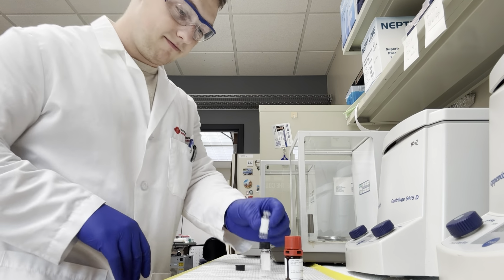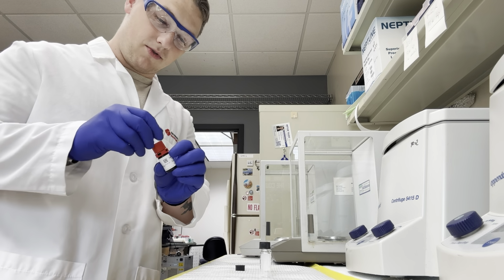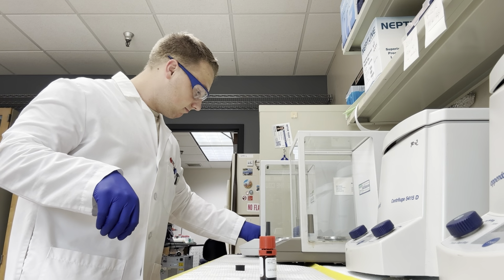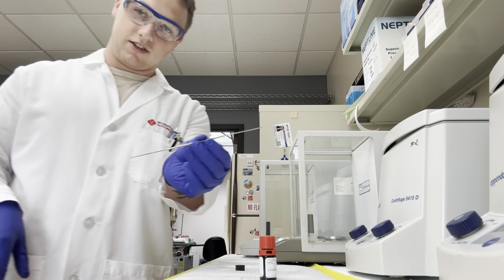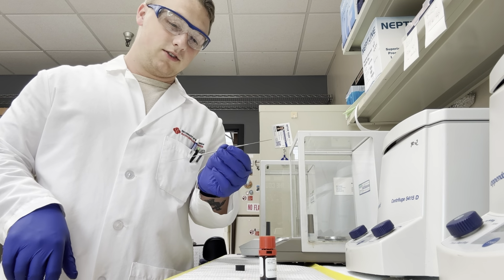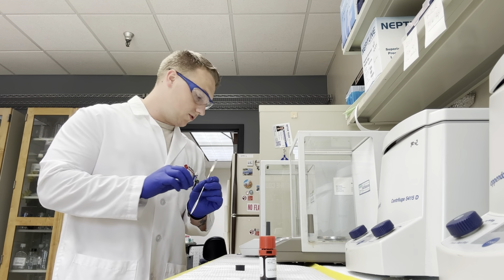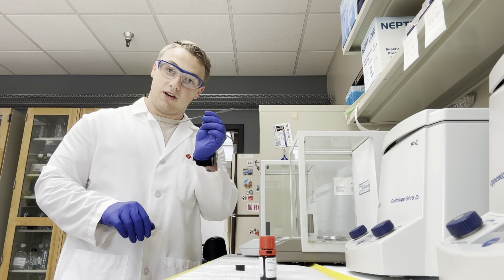So we have it here, and we have our sample here. For that, we're going to get our little spatulas, such as these, and we're going to scrape some out and put it into these containers. Anytime you pick up these tools, and we have a pile of them over here, I've been told by a very wise person that if you haven't been using it, assume it's unclean.